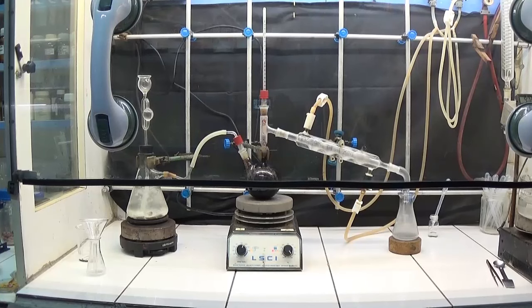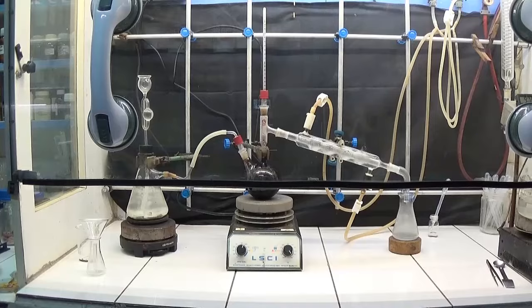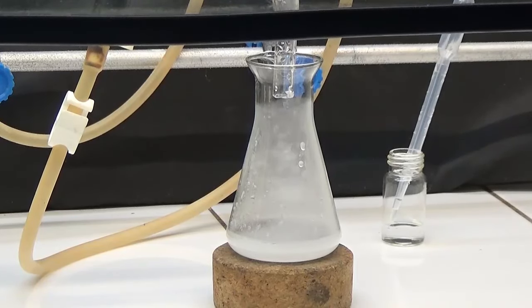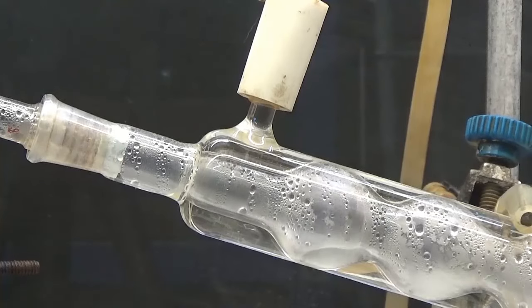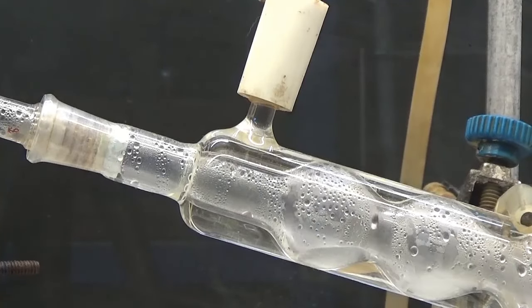Working in the fume hood is very important because this is where the smell is most unbearable. During distillation, 2-furan methanethiol is observed as an oil that distills with water. Water distillation stops when no more distilled oil.